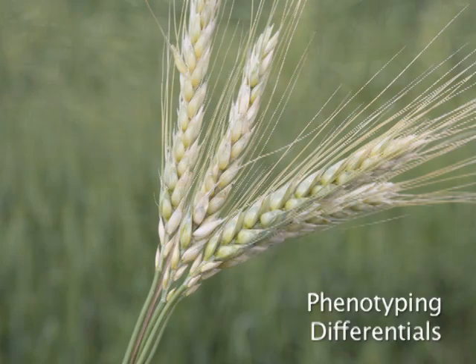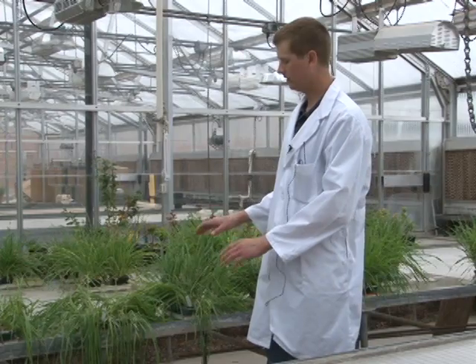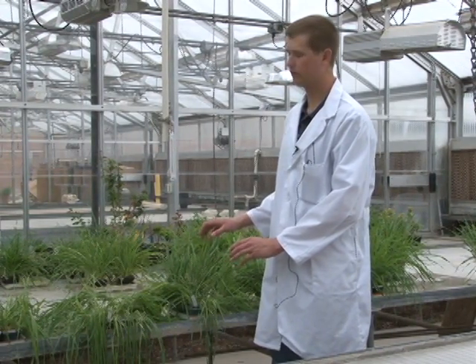Phenotyping differentials. I am going to describe how to read or phenotype the differentials. These differential trays displayed here have been in the greenhouse or in a growth chamber for two weeks after inoculation, and now they're ready to be read or phenotyped. Phenotyping the differentials means classifying the infection type for each differential line. The infection type is simply the interaction between the rust isolate and the wheat line.